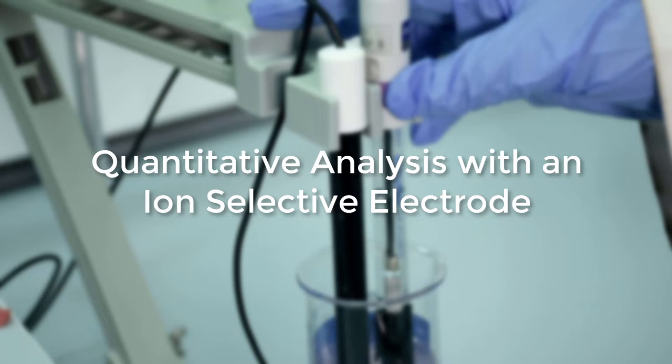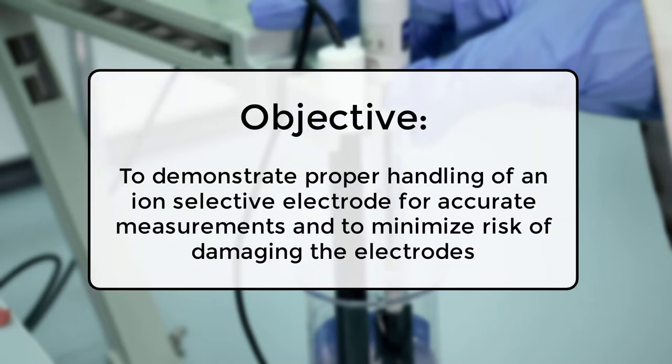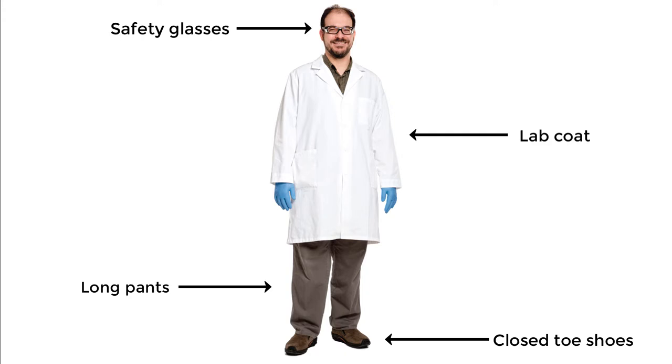Quantitative Analysis with an Ion Selective Electrode. To demonstrate proper handling of an ion selective electrode for accurate measurements and to minimize risk of damaging the electrodes. Ensure you are wearing proper personal protective equipment when working in the lab.